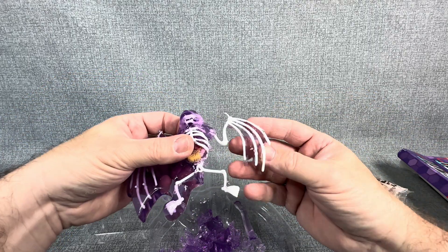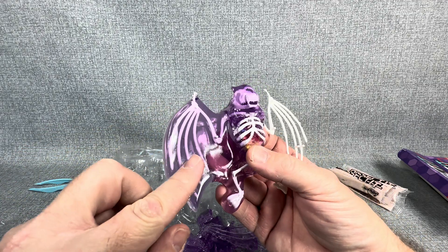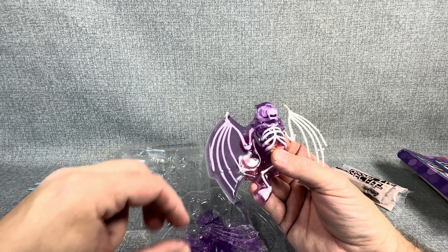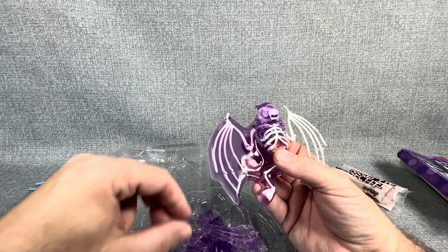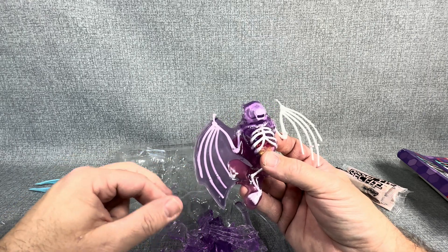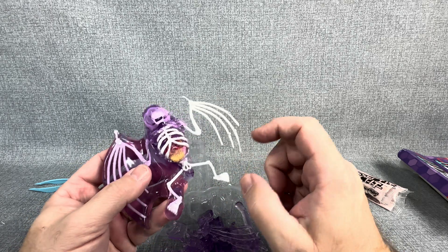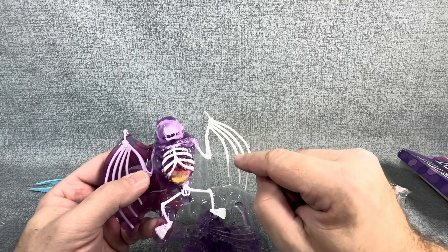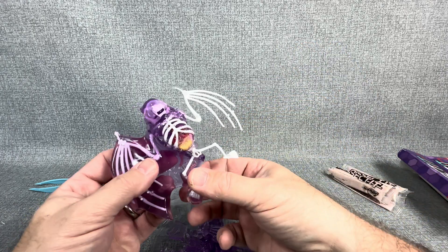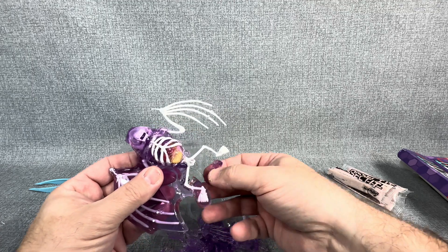What I will say about this — this gel mixture, imagine if you were eating the hardest Jell-O that you've ever eaten. That's similar to what this feels like. So when you start to cut it, it kind of tears apart in places. But as you can see, we've revealed the entire left skeletal wing there. Instead of just cutting it, to speed things up I'm going to go ahead and just try to peel the rest of this stuff off.